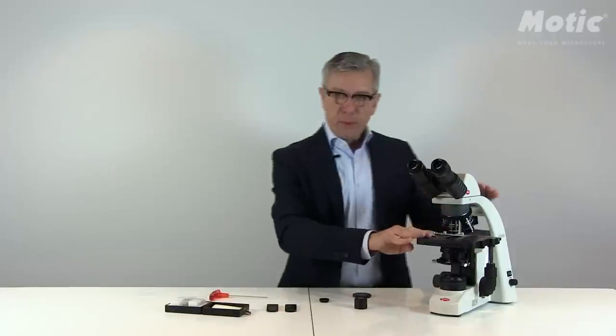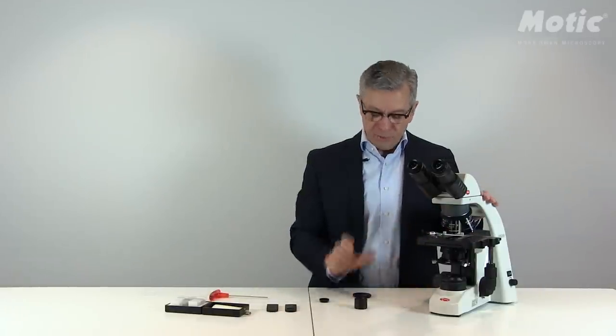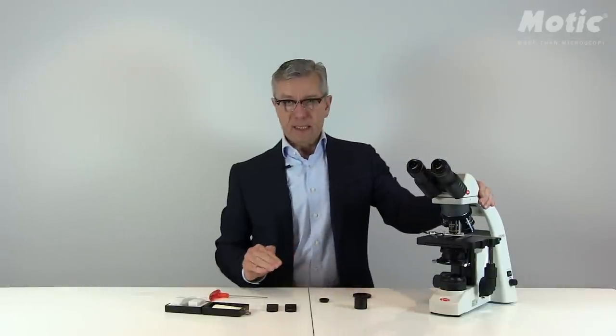That means if there is no sample on the stage, the background will be as dark as possible. We have to move the polarizer a little bit, but at the end the background will be as dark as possible.